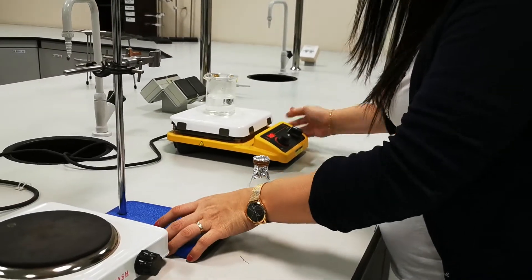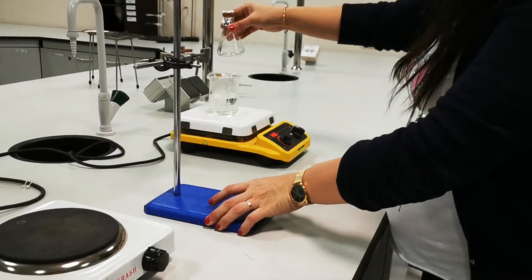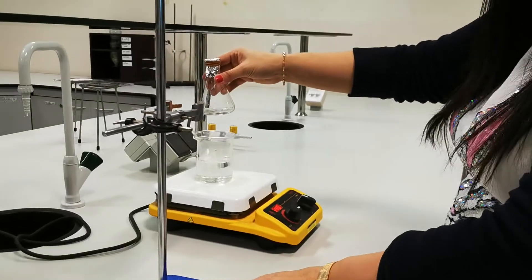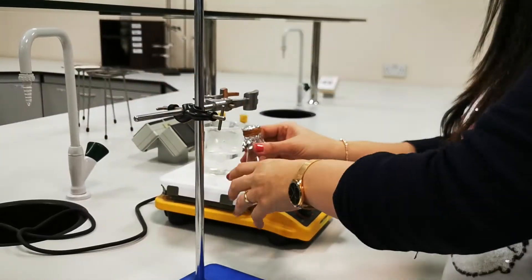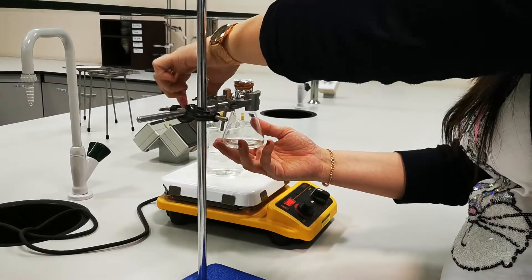Once the water starts boiling, I will immerse the volatile liquid. So, I'm going to prepare this volatile liquid over here.